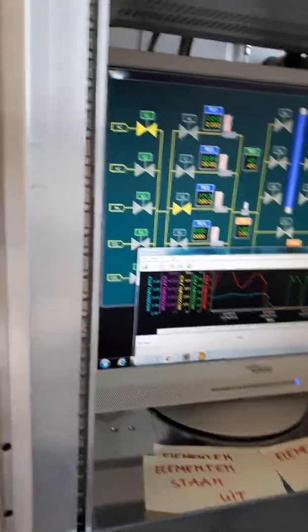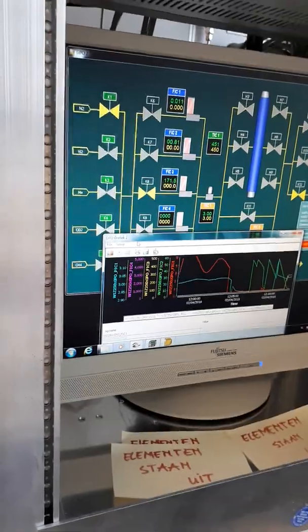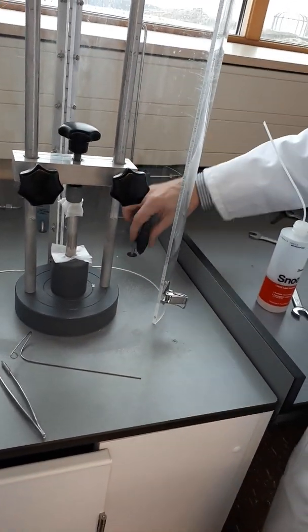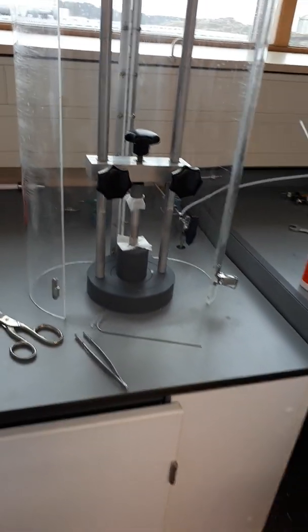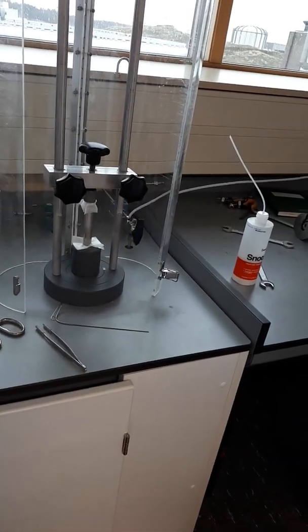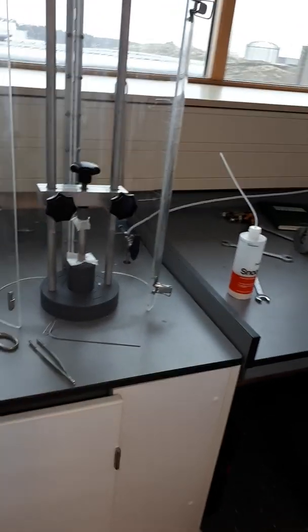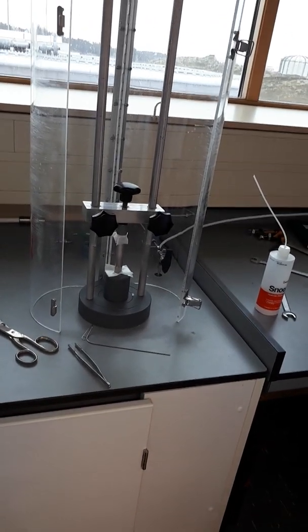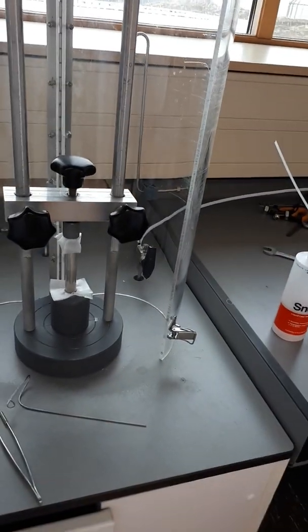So 171 is actually leaking from the system and the membrane. So we will check again now if it's tight enough. 1200, 1300 is still... Because if we have 100 milliliters leakage through another part, I think we have this 1300 that we see here, but I'm not sure. That's one of the first things to check. This one was closed, and this is well tightened, so it means that this 170 milliliters is from the membrane, leaking through this layer, our dense layer, the palladium layer. But 171, I don't think it's dense. We will take a look again. I don't think this is dense. Okay. The first one was also not dense.